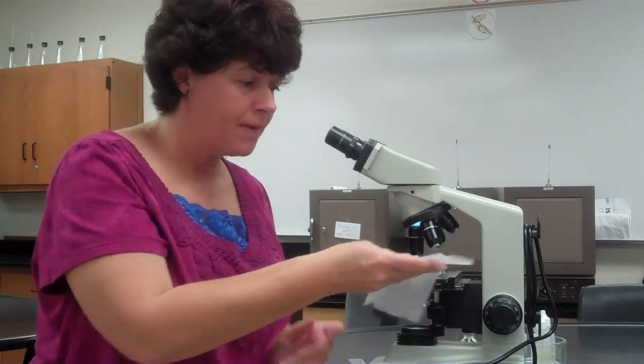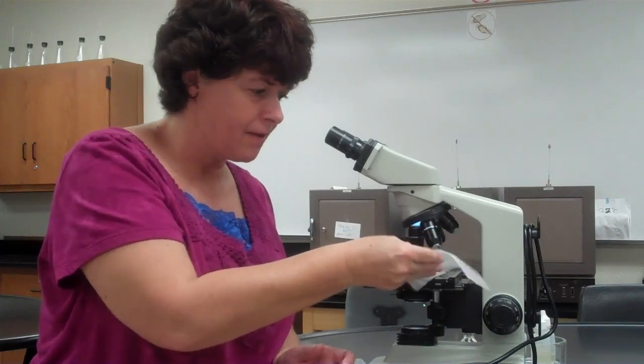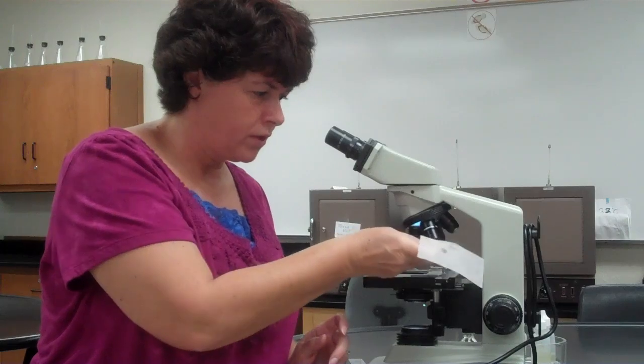Don't use any other kind of paper. Don't use a paper towel. Don't use a chem wipe. It must be lens paper. And I do not want you to rub it off, and I want you to be very gentle, okay? So you just take the paper and you dab, and you go to a dry spot and you keep dabbing until no oil comes off.